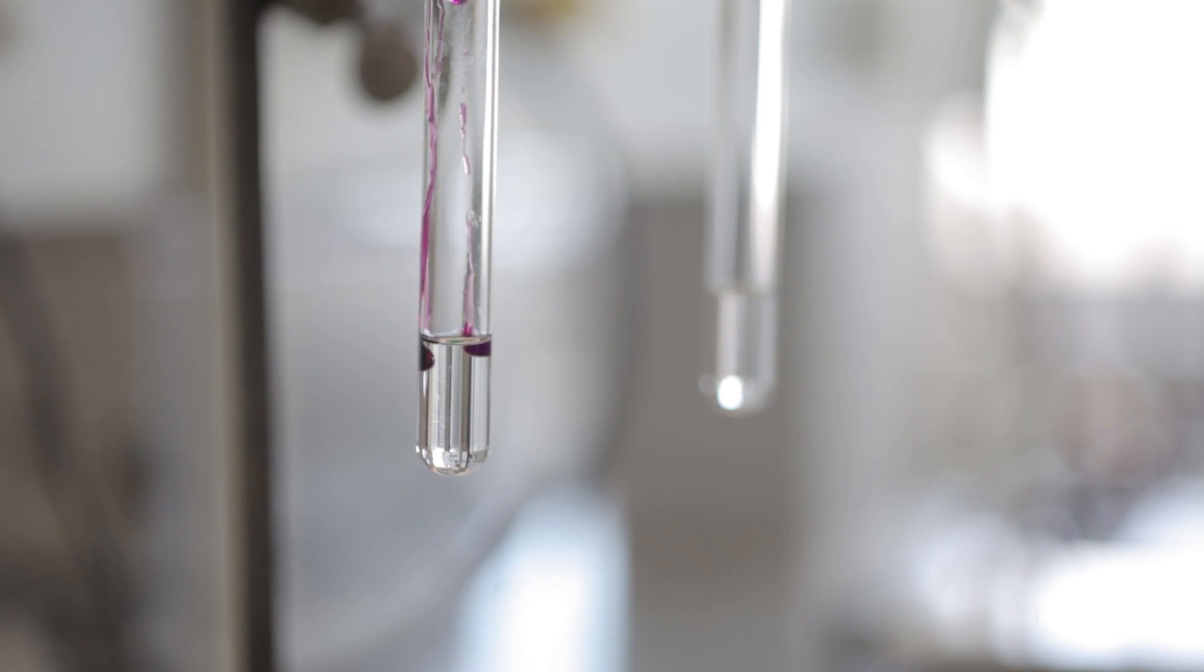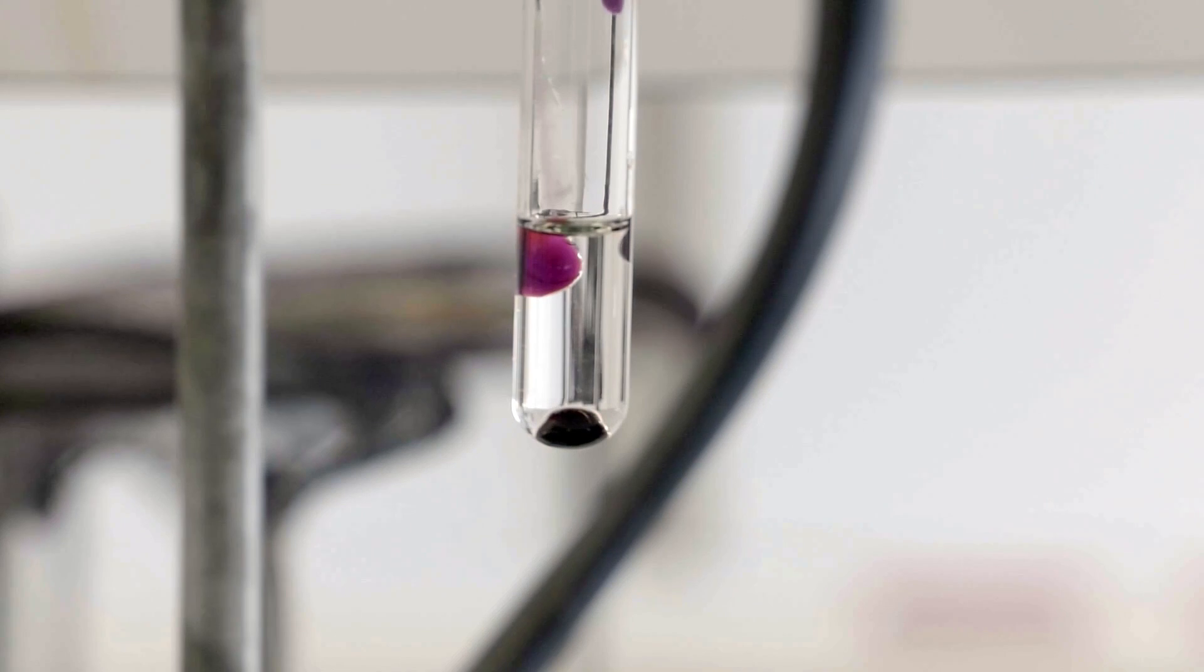As a second step we add a few drops of potassium permanganate solution with a micro pipette.